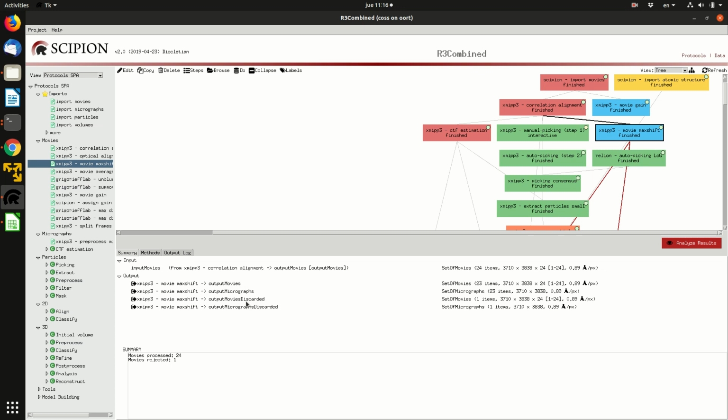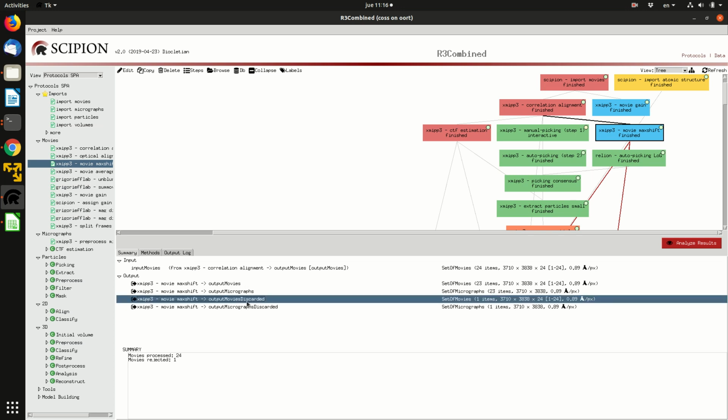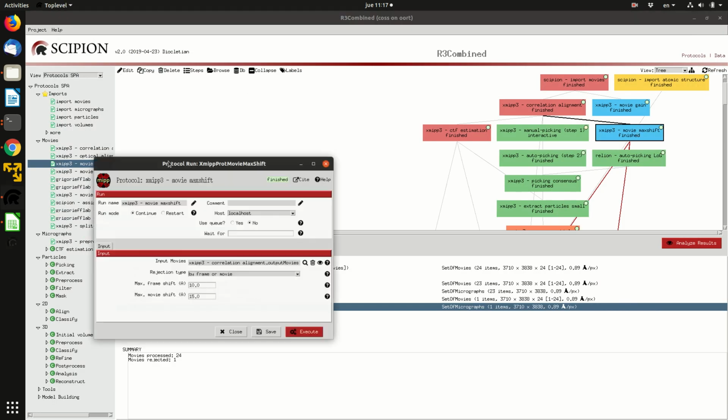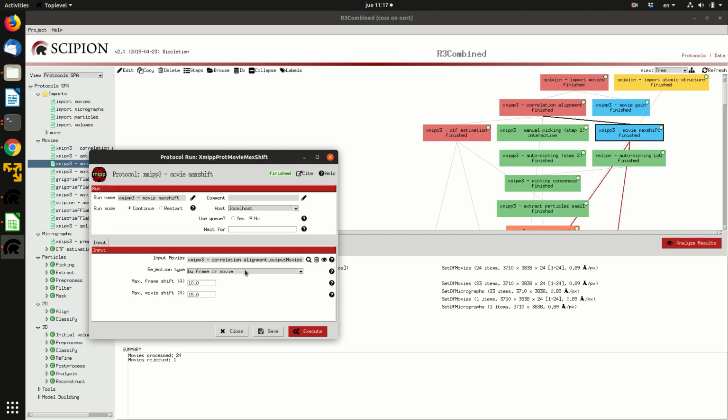The discarded are never deleted from the disk, so you can always go to the discarded and check why this movie has been discarded, and take a decision on whether I should use it still or not. And the criteria to discard are here. So you can reject movies either just by frame, just by whole movie, by both, or there are many possible combinations. So this one is if from one frame to the next there is a jump on average that is larger than 10 angstroms, and this is a lot.